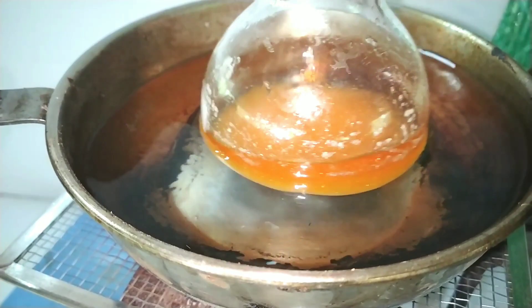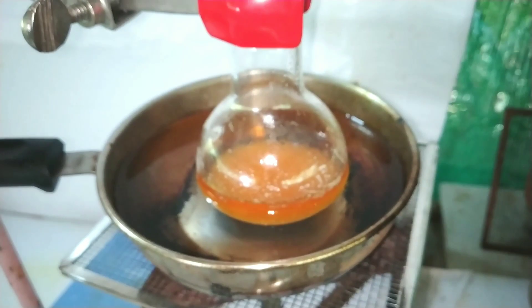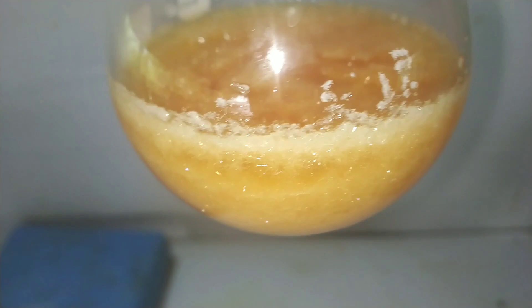After about 1 hour, crude crystals of benzoin have already started to appear. Continue heating the flask for the remaining 30 minutes to ensure complete reaction.